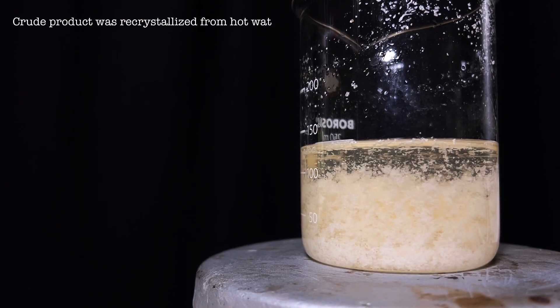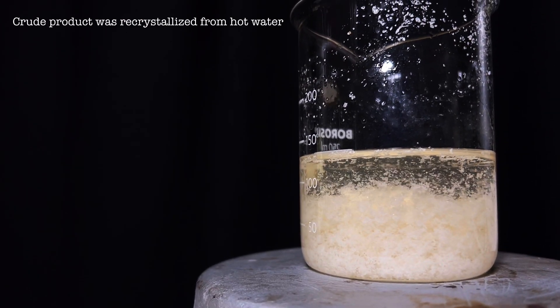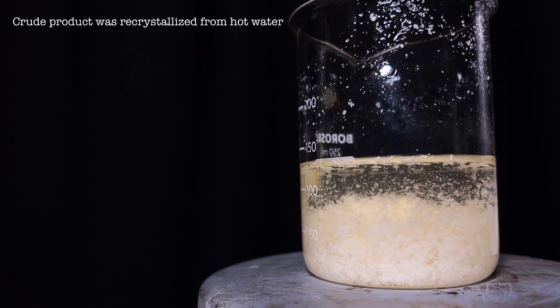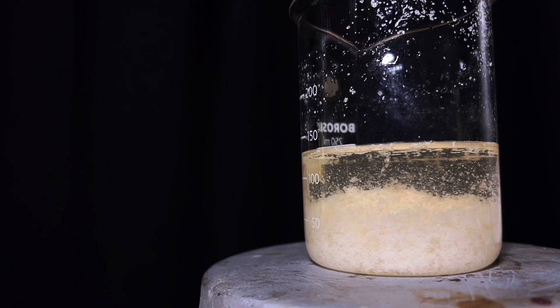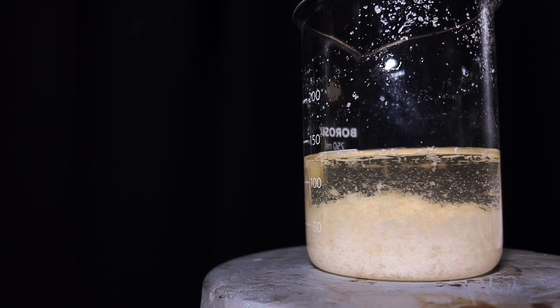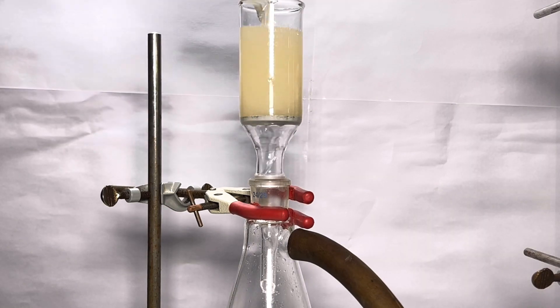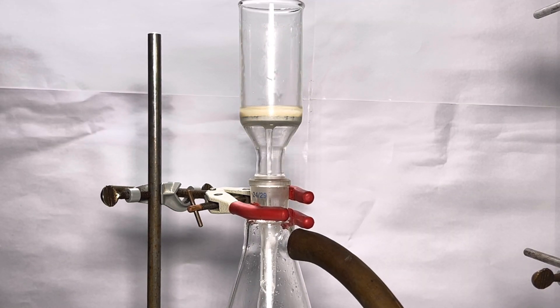It was then recrystallized from hot water and these are the purer crystals. It was vacuum filtered and pure product was collected.